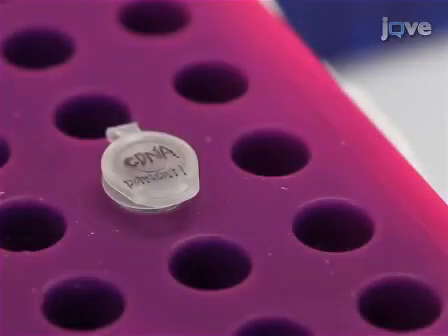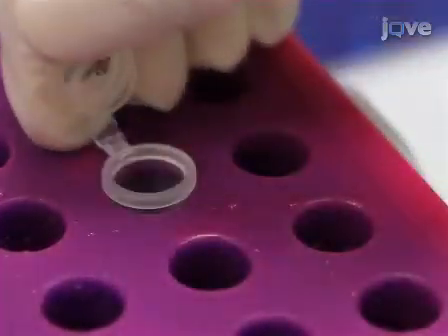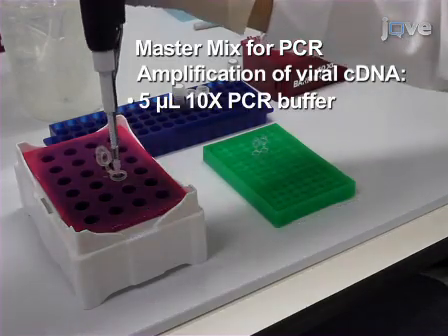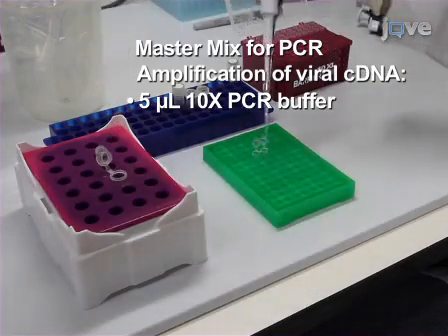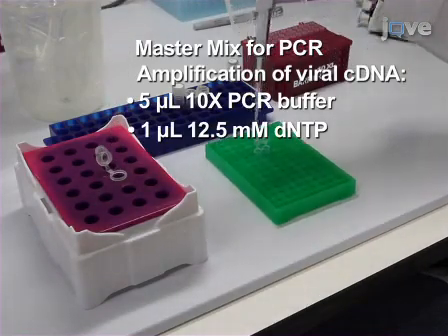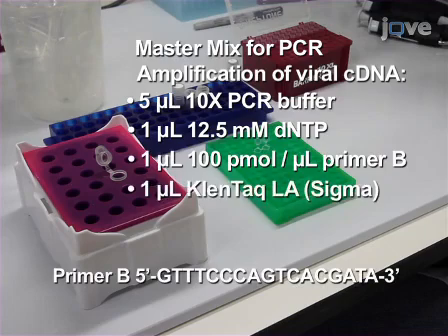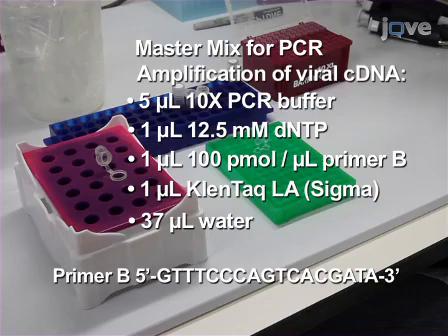First, add 5 microliters of cDNA sample to 45 microliters of a master mix consisting of 5 microliters 10 times PCR buffer, 1 microliter 12.5 millimolar dNTP, 1 microliter 100 picomole per microliter primer B, 1 microliter Klentaq LA, and 37 microliters of water.